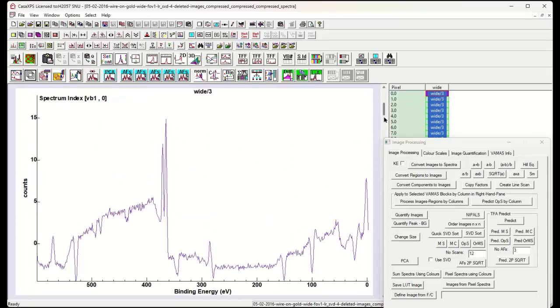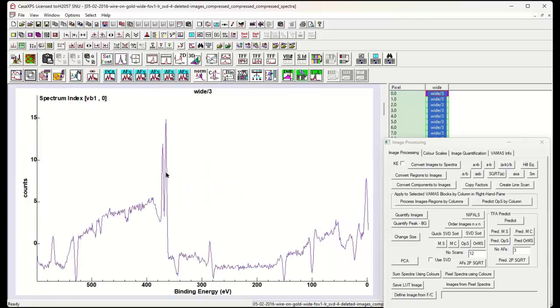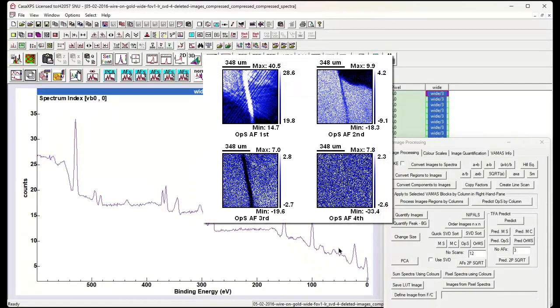But essentially we still have the 3 abstract factors that we had before that were representative of gold and silver and mostly the glass. But it's not really mostly the glass. What it is is the total spectrum. It's not quite the total spectrum. PCA doesn't calculate the total spectrum, but it's very close to it. We have to iterate to get to this spectrum. You don't have to iterate to calculate the average spectrum. But the essential features are the same.